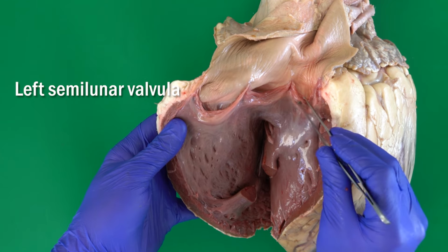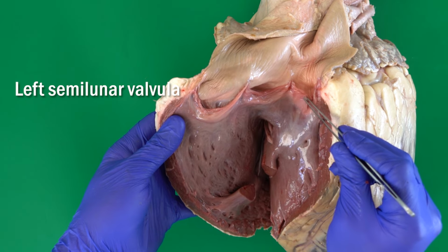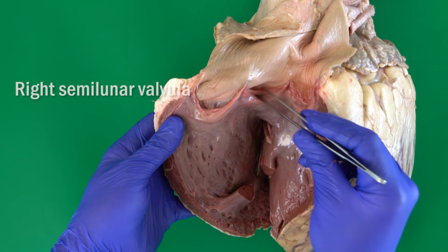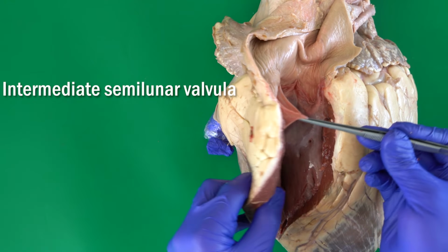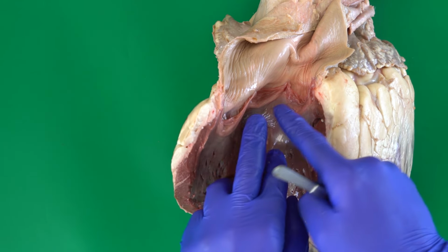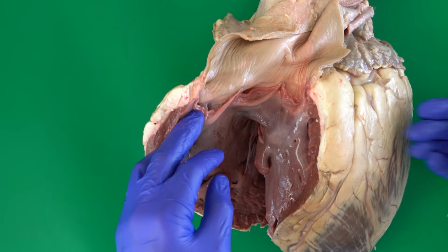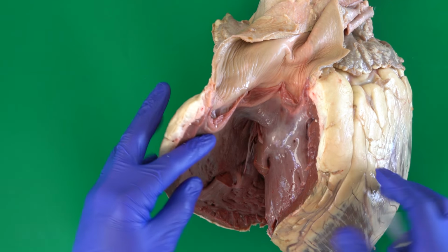We have the left semilunar valvula, the right semilunar valvula, and here we have the intermediate semilunar valvula. We have actually something similar to this between the left ventricle and the aorta, called the aortic valve.